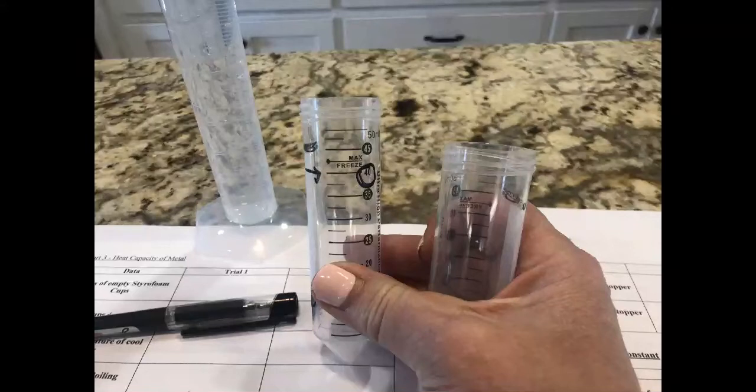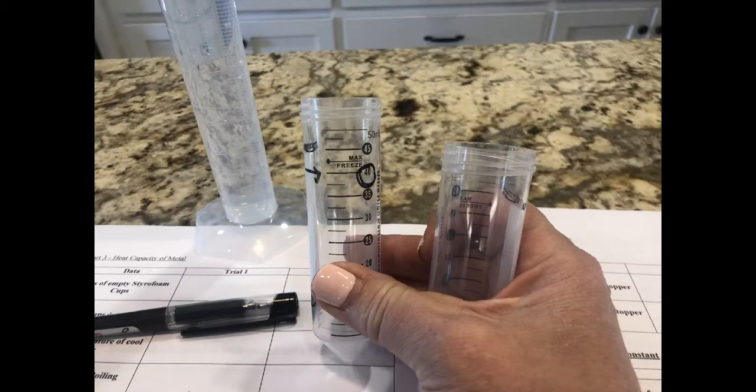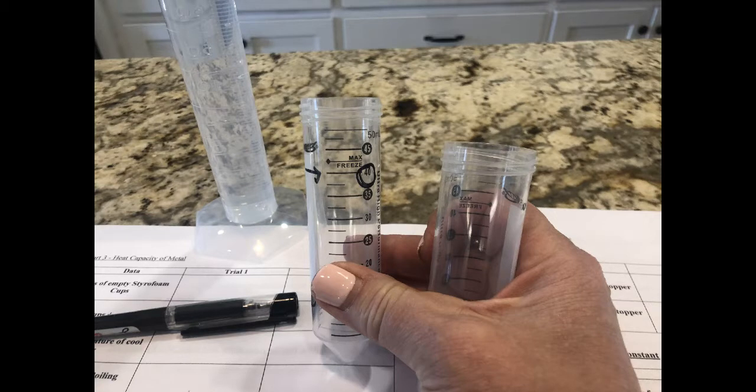Part 1, Step 1. Put about 40 mils of cold water into each of two large test tubes. We'll know how much by mass.